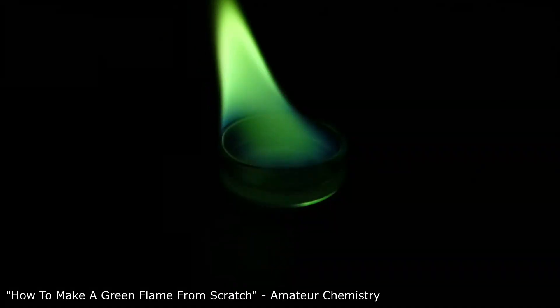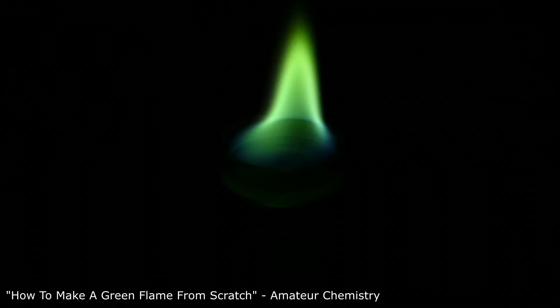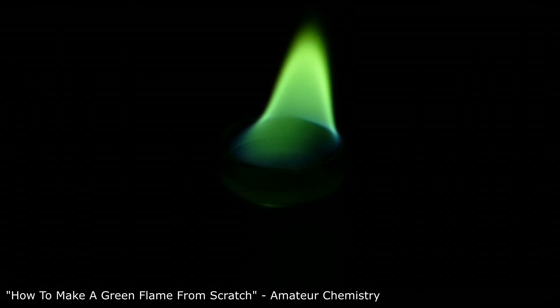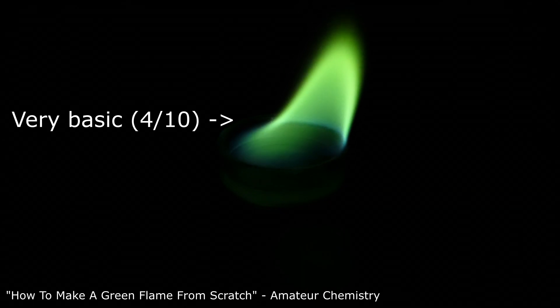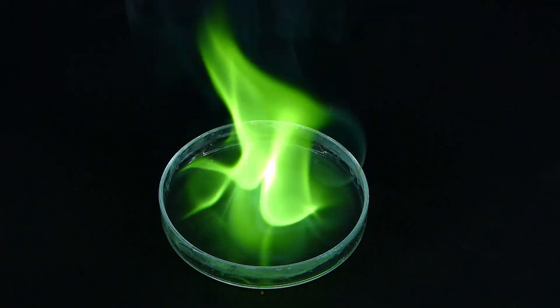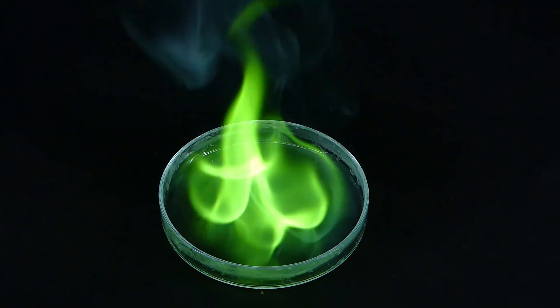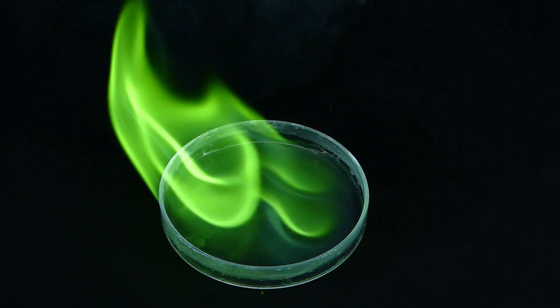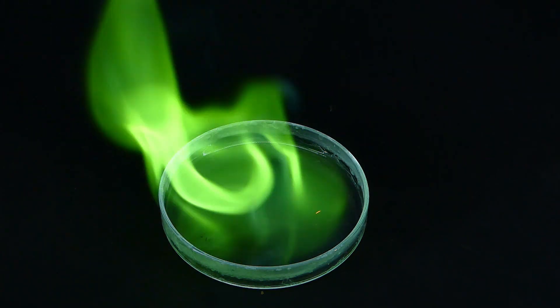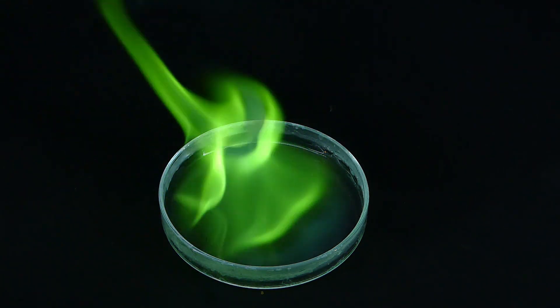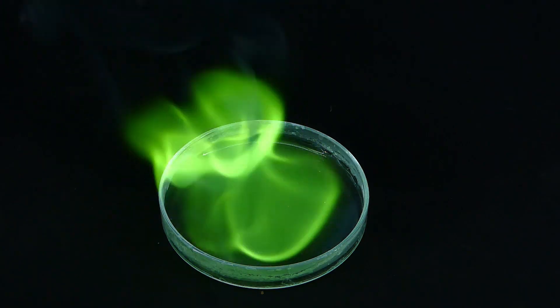This color was produced by introducing boron atoms to a flame, and in that video I showed a very basic example of that. But now, after almost half a year, I have gained enough experience and equipment to make an upgraded version of that fire. But before I do that, let me quickly show you how to make the basic version, because it is really simple.